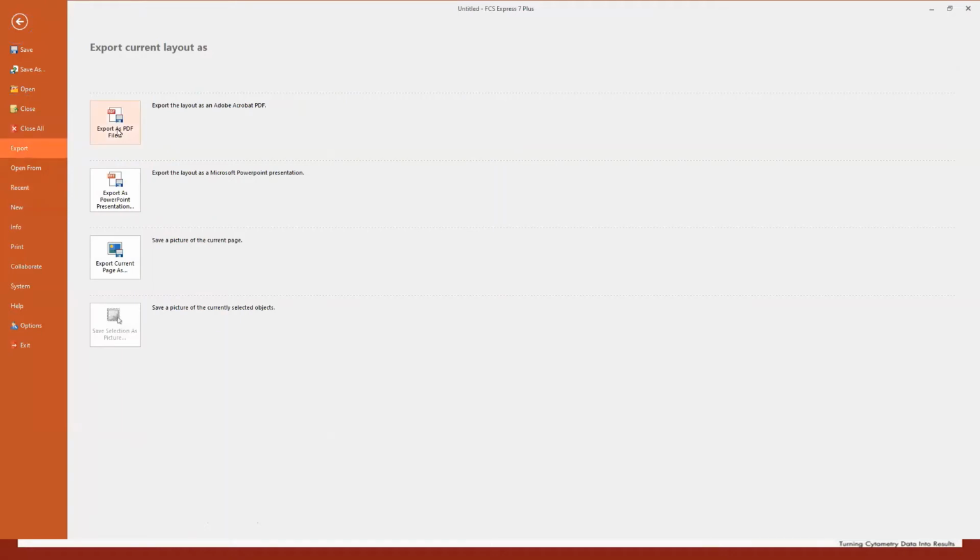If you want, you can export your FCS Express layout directly to PDF, or to PowerPoint as a high-resolution picture. You don't need to do a single copy and paste. Copy and paste to PowerPoint is something that people do a lot if they do not have FCS Express, and it's really time consuming, it's annoying. In this case, you can do everything you want in FCS Express, and at the very end, with a simple click, you can export to PowerPoint directly.